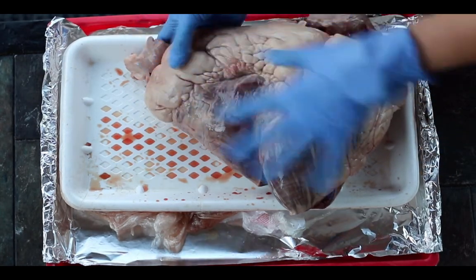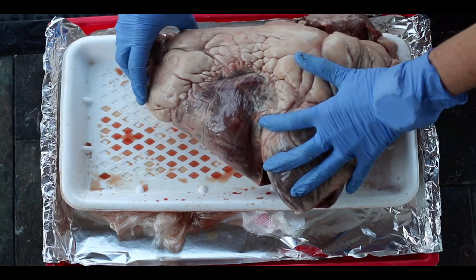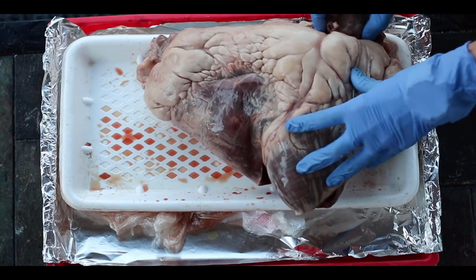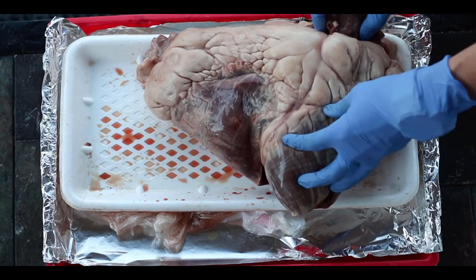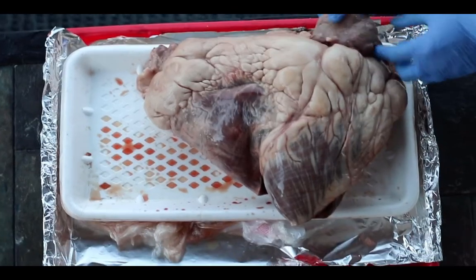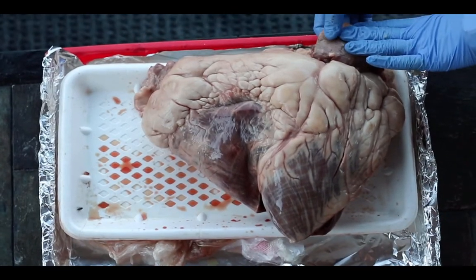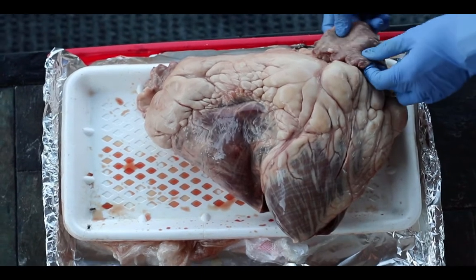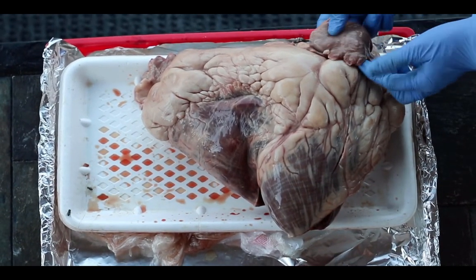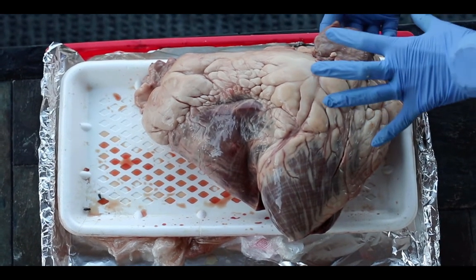The anterior interventricular sulcus tells me this is the anterior portion of the heart. So if this is the anterior side, then this has to be the right atrium and right ventricle, and this is the left atrium and left ventricle. What's really cool on the beef hearts is you can see the auricles quite well — especially the left auricle here. Remember, these are just the sac-like portion of the atrium that allows for expansion of that chamber.